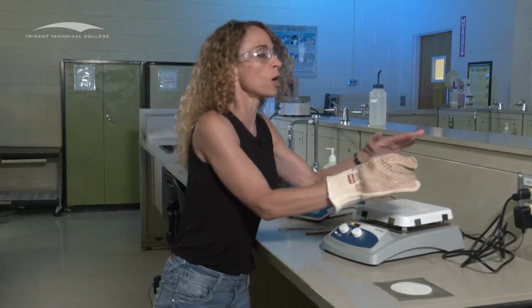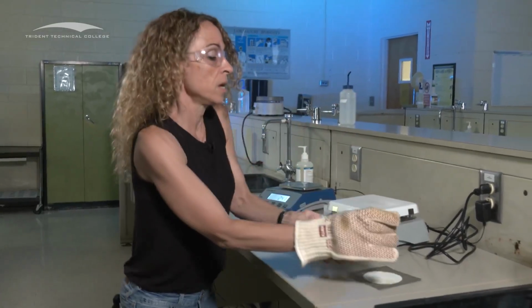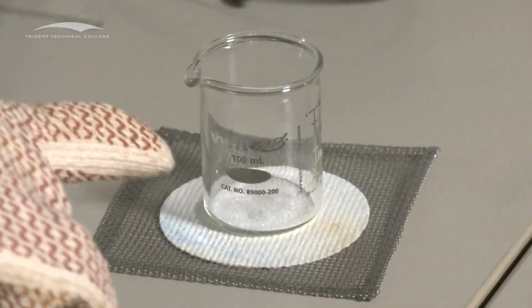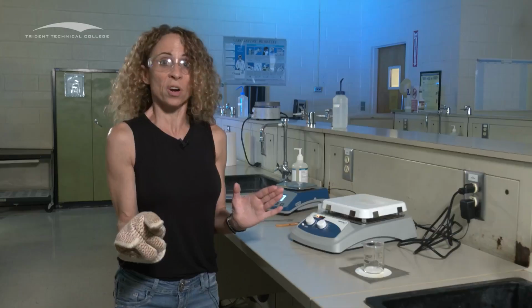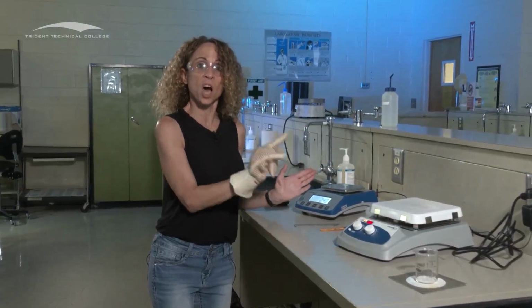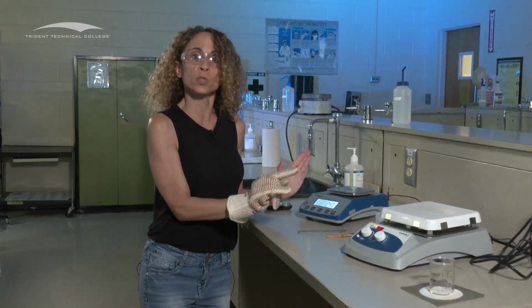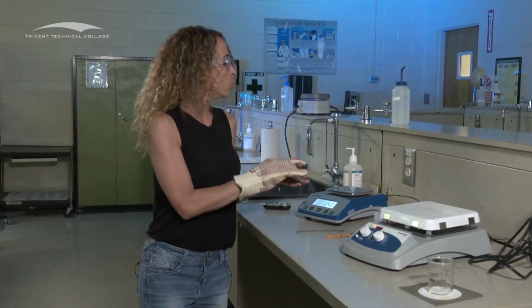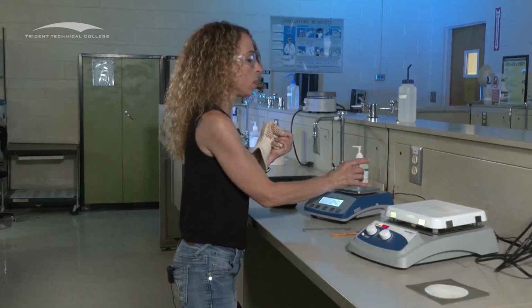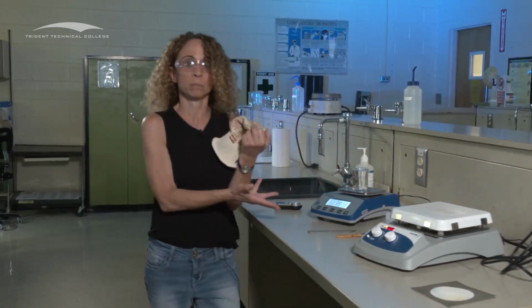And now don't put it directly on the bench top. You're going to put it on this wire gauze. Put it on there. Let it cool. Now, pretend this is hot. Don't put it onto the balance and expect to get accurate results. When you put something hot onto the balance, it causes the air around it to flow upward, which is going to interfere with your reading. So let it cool for 5 minutes, and then you're going to put it onto your scale and weigh. Tare first, of course, and then weigh.